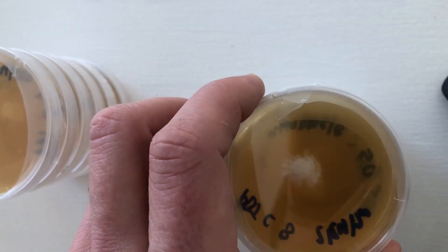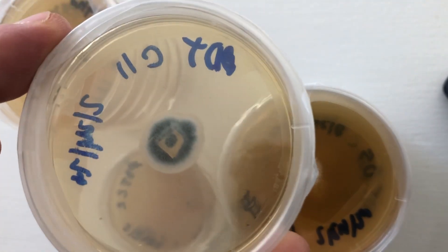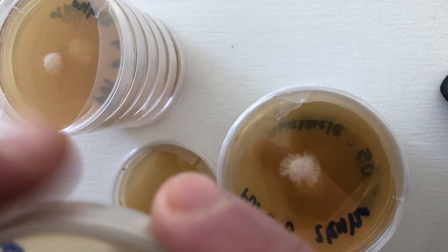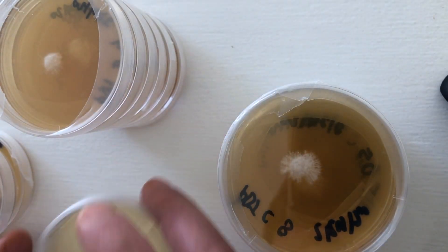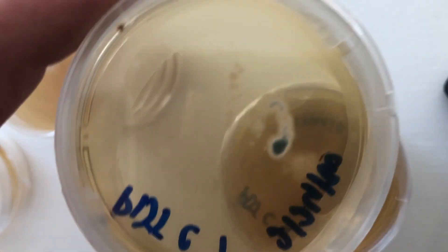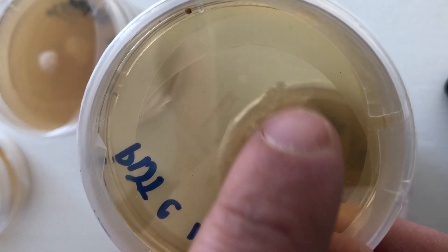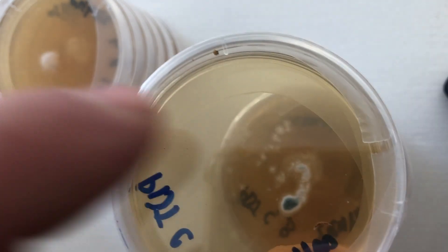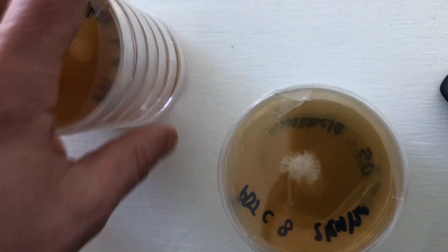Though it could have just been my fault. I've got a couple of plates that are actually contaminants — this one was a penicillium mold that I accidentally captured, and then some yeast from the streak plate. This one is interesting because it looks like the penicillium got in early in the streak, but then as I streaked it out it isolated for the mycelium on this end, so I can go ahead and take this isolate and move it onto a new plate. Here are the rest of the pink oyster isolates.